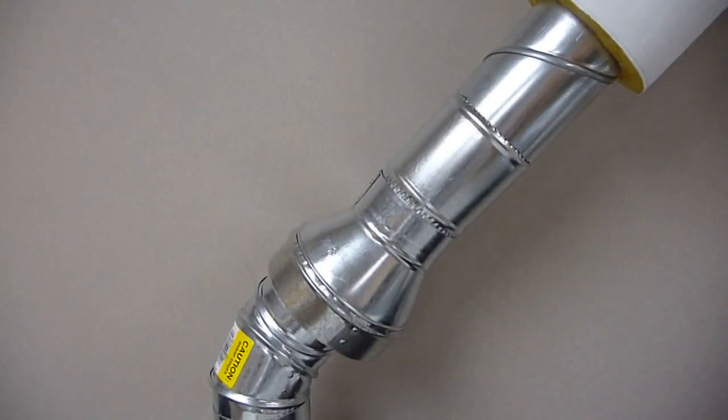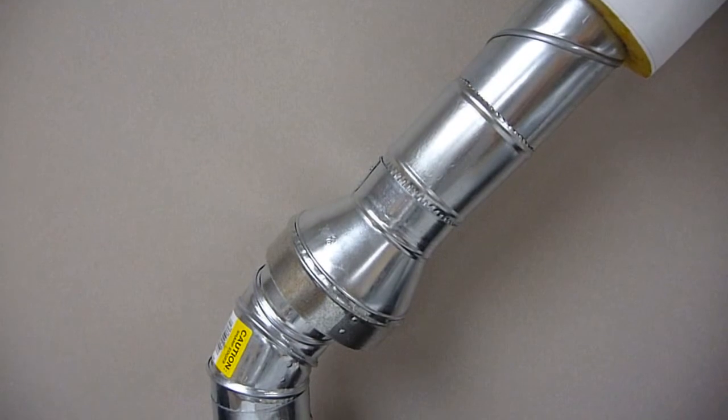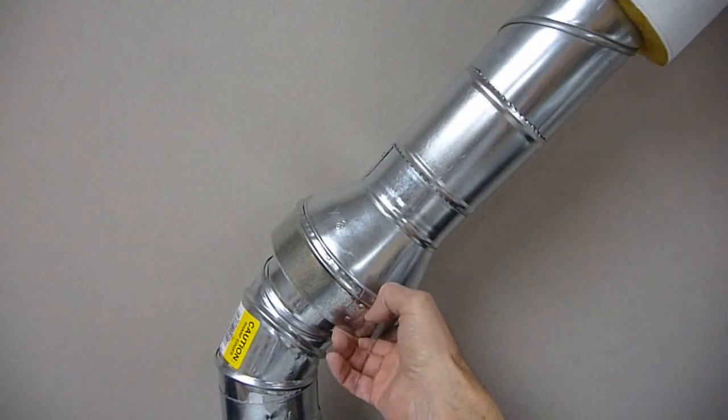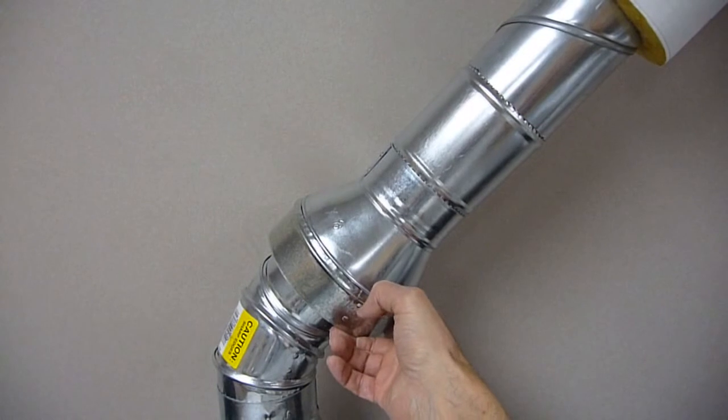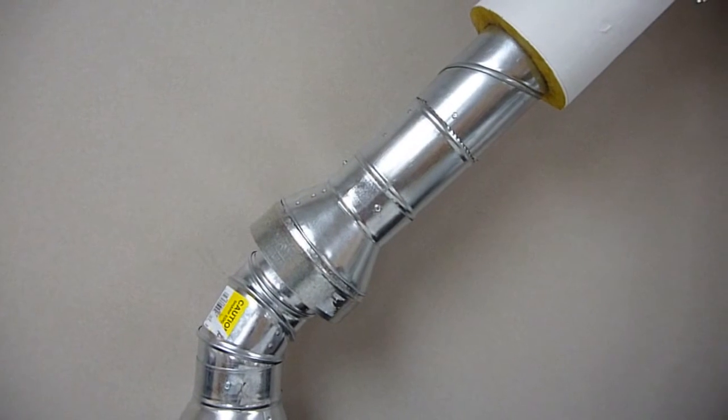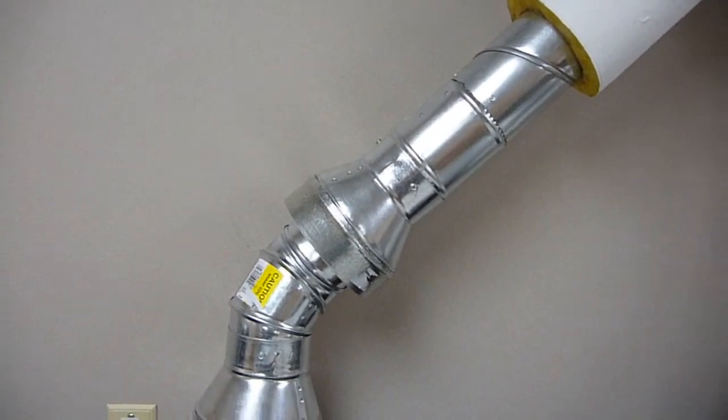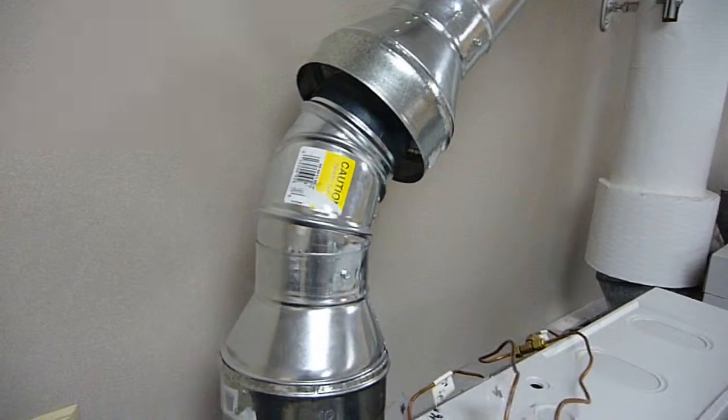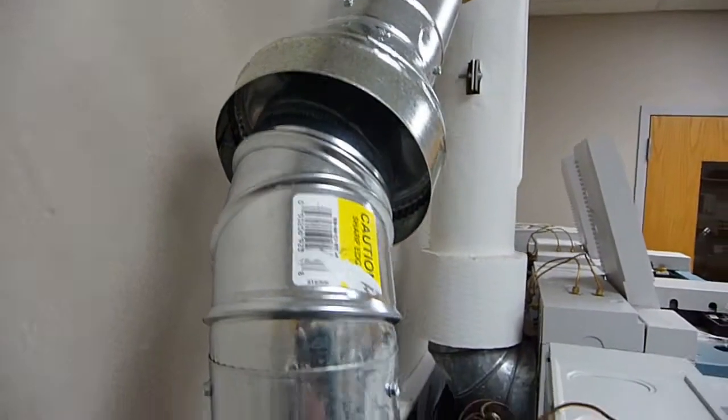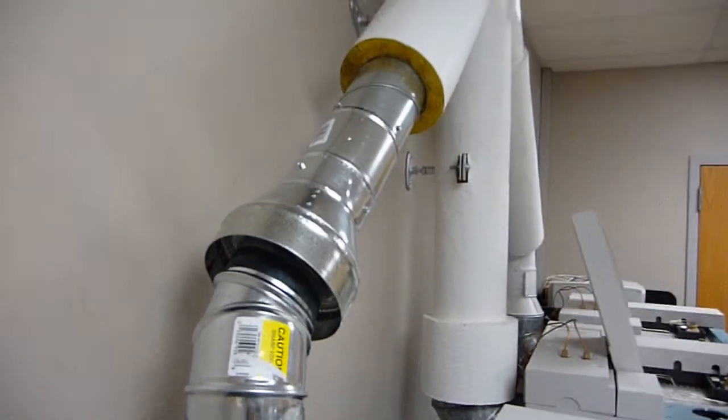This is the preliminary installation. I'm going to use sheet metal screws and make the joints nice and secure. But you can see, right here, we're going to have a nice open split. So, we won't have any suction pressure on the oven flapper doors. And that's the completed construction assembly. All that's left is giving it a couple of coats of white enamel paint. So, we have our open split arrangement so that we don't have any suction pressure on the oven flapper doors.